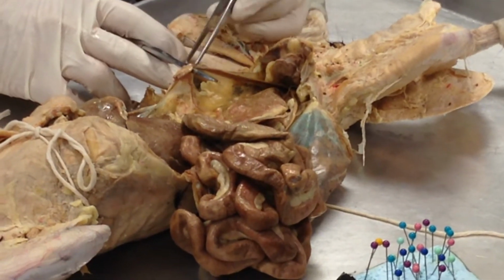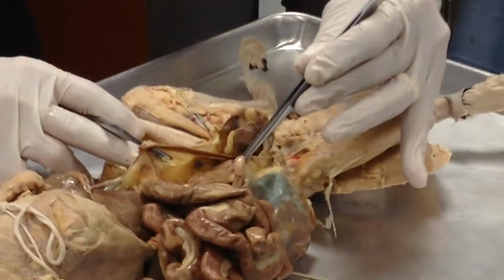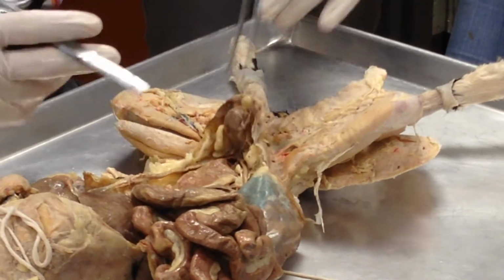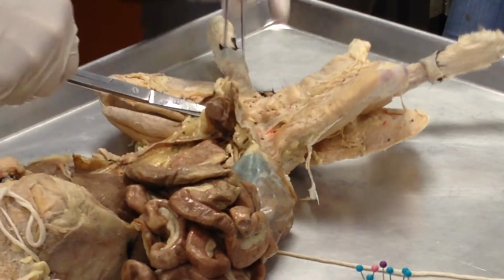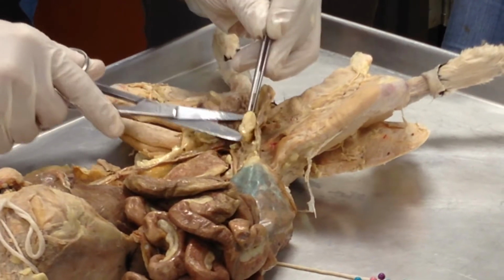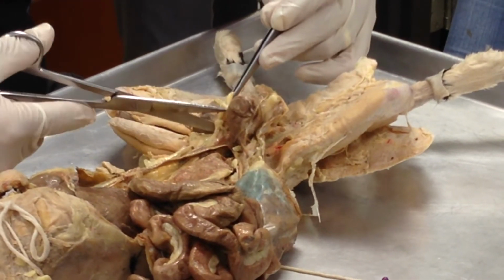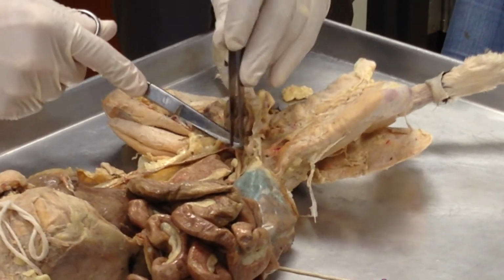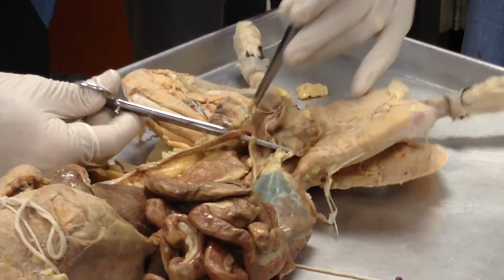So what is all of this then right here? And what is all of that right there? That is a Y-shaped uterus right there. Okay? So what we're going to do is, let me cut this out of the way right here. So there's the bladder right there. The fat pockets will just slip out of the way. Don't have to worry about the vas deferens, so I can cut them more aggressively there. And then there is the uterus as well. So what we see, folks, is Y-shaped right there.